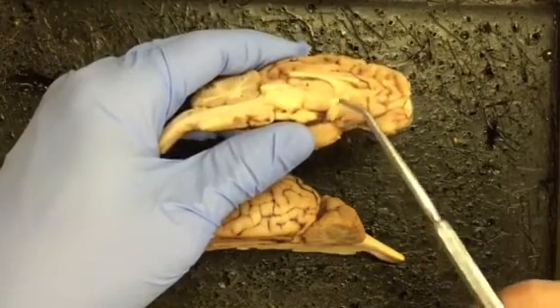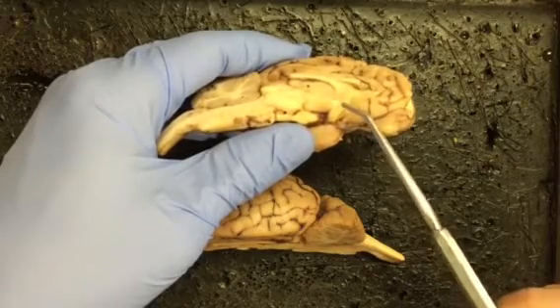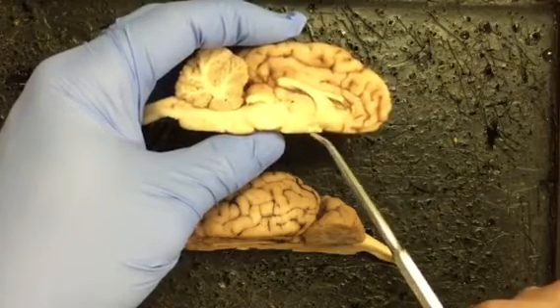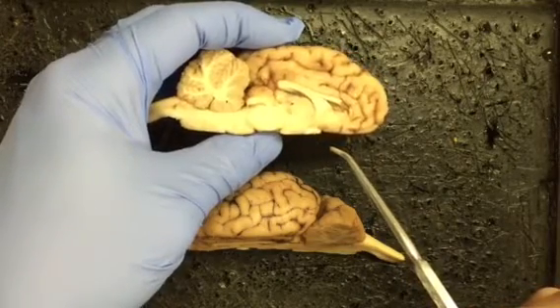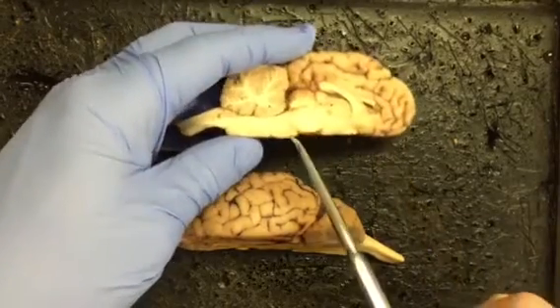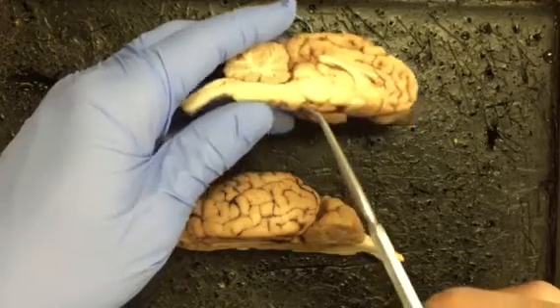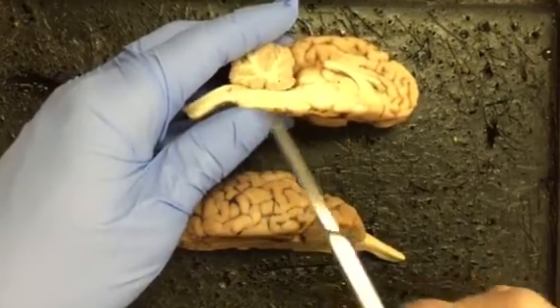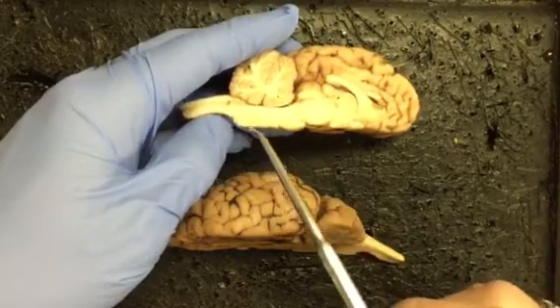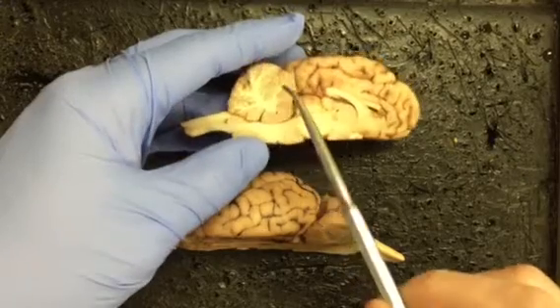Next, we're looking at the optic chiasm. If you recall, the optic tract crossed over with the other half of the brain, and in the center, that was the optic chiasm, and we can see that white fiber tract in its side view. We then have the pons. Now, if you recall, the pons was this anterior region of the spinal cord area, this being the spinal cord back here. So the pons is this region right here. The medulla oblongata is directly below the cerebellum, which is up here.